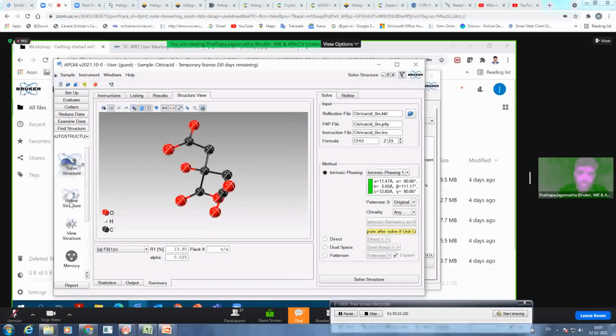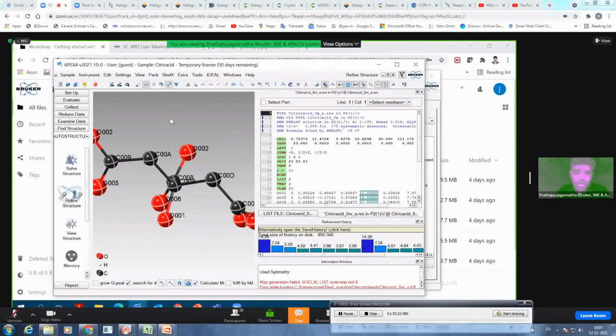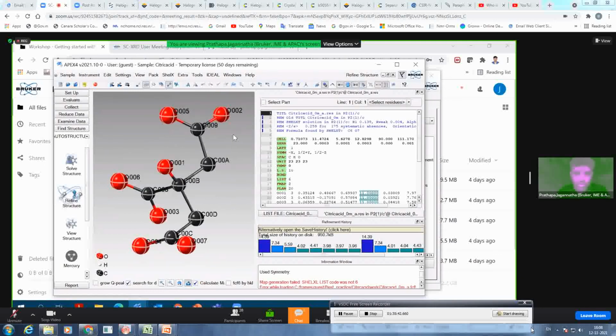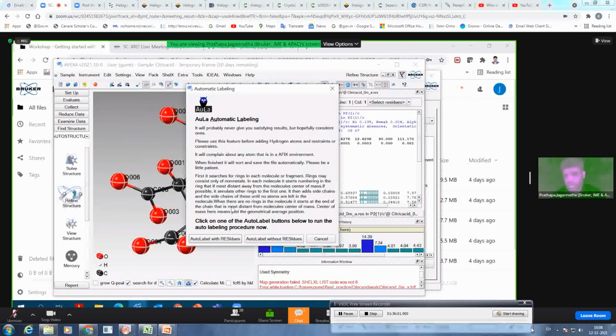From here, we can quickly go to refine structure for further refinement and to finalize your structure, because you have already got your structure. So you can see it. The only thing is it randomly labels your atoms, with some different nomenclature. You want to make everything professional and complete, like instead of O001, you want to call it O1. You can do it by hand if it is only a few atoms. If it gets to more atoms, then you are in trouble. That's why Apex 4 or ShelXle come up with the auto option, that is ShelXle automatic labeling. You can label several atoms, hundreds of atoms together, with just one click. You can do it with residues or without residues.